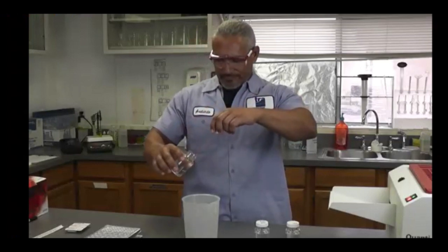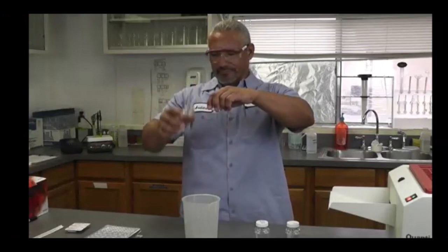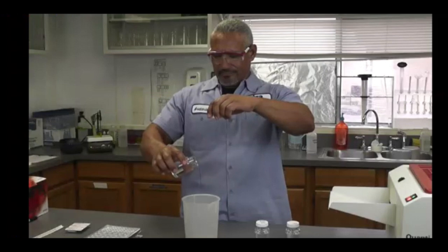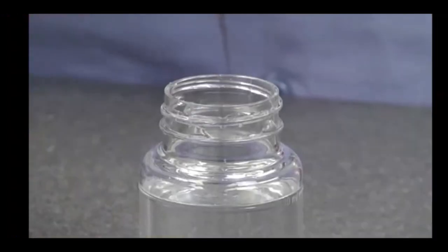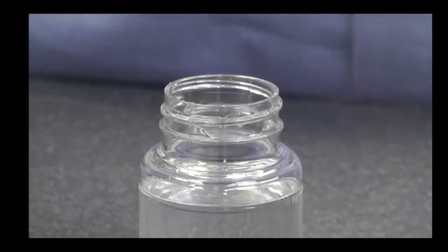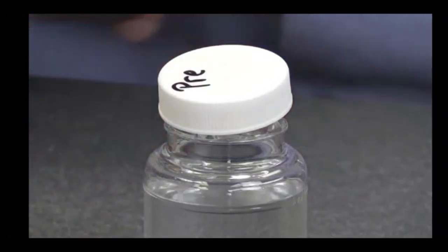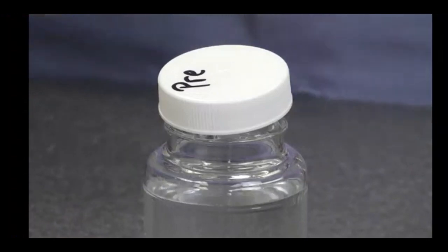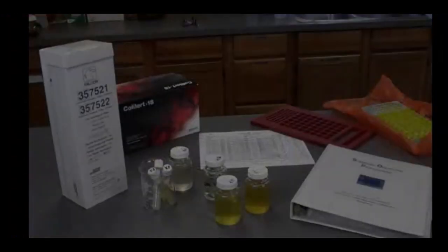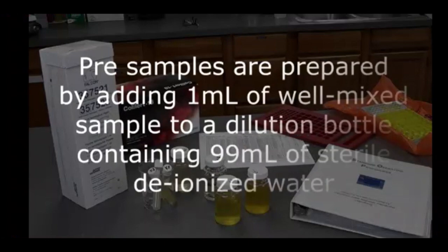Remove the cap, but do not put the cap down on the counter. Keep the cap pointed in a downward direction to prevent airborne bacteria from settling in the cap while adjusting the volume. Do not touch the inside of the cap or around the neck of the sample bottle. Rest the cap back on the sample as soon as the volume has been adjusted to prevent airborne contamination of the sample. Post samples are set up with no dilution.